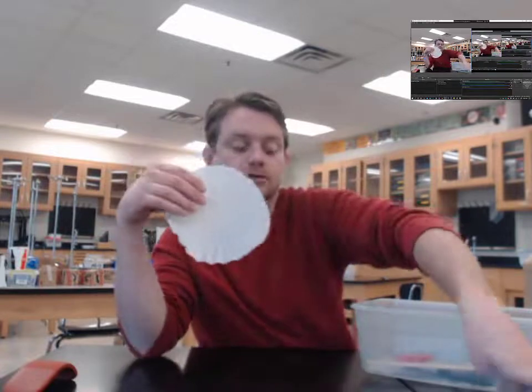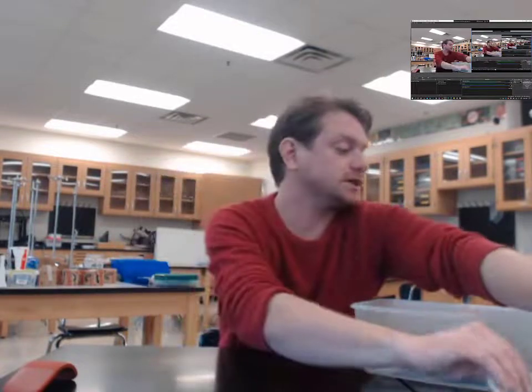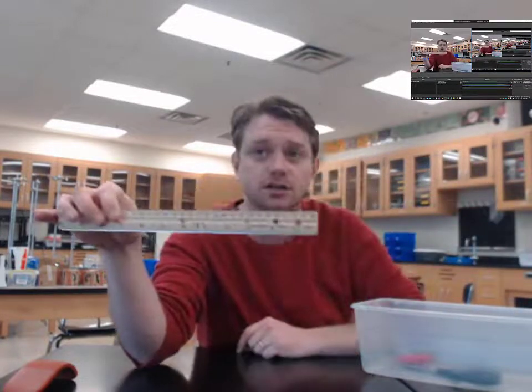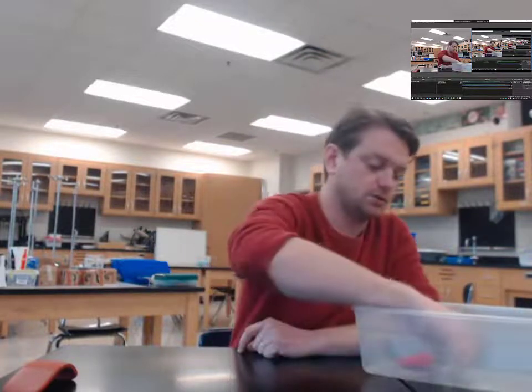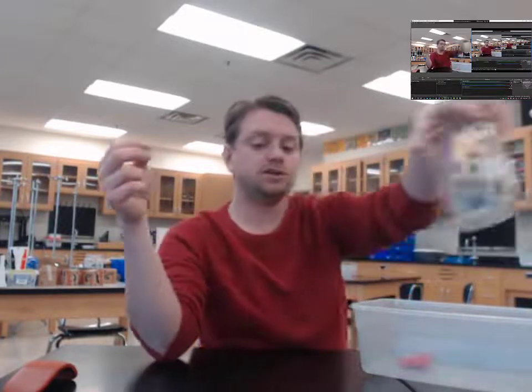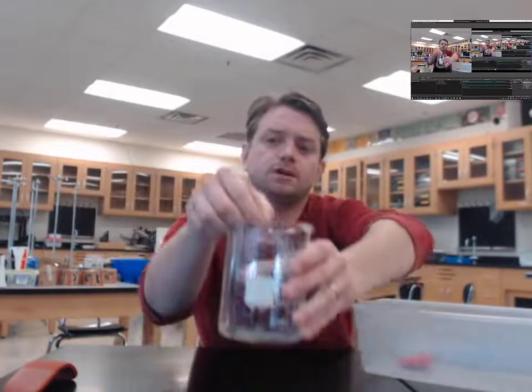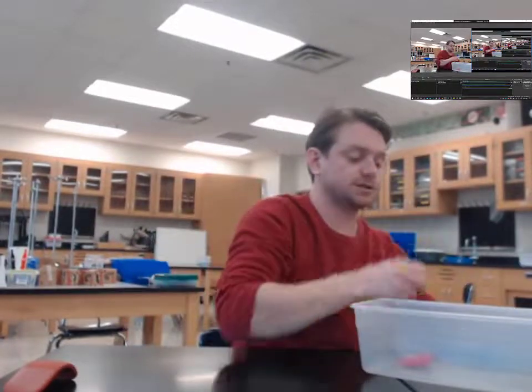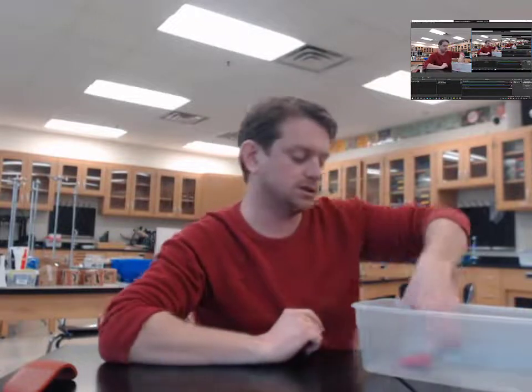We have a couple other materials that we're going to need to use. Besides our coffee paper filter, our mixtures of ink, our beaker and our solvent, the isopropyl alcohol, we'll also use a ruler to control the width of our slices of filter paper. We'll need scissors for that. We'll also be taking a couple of paper clips, which will be folded out into a more or less straight line, and that will hold our filter paper above our solvent so that the filter paper hangs from the paper clip and just barely touches the surface of that isopropyl alcohol solvent at the bottom.